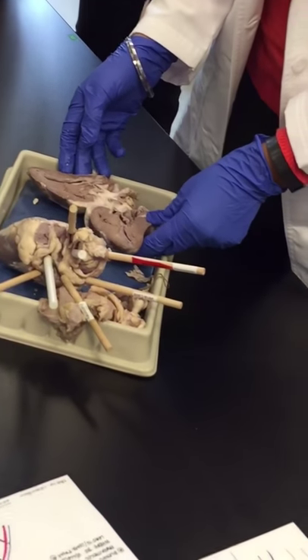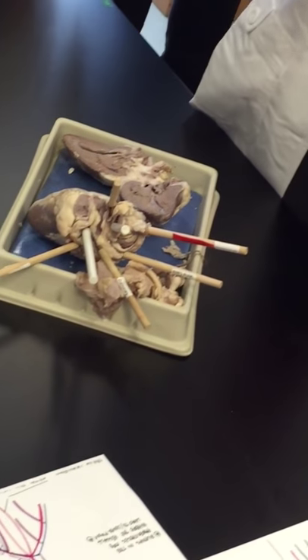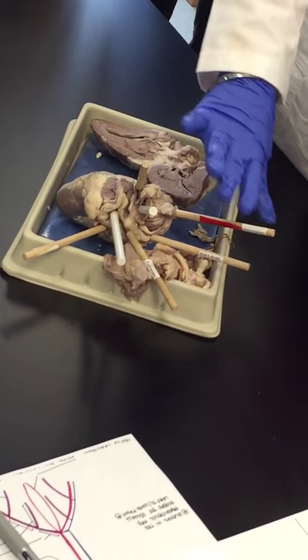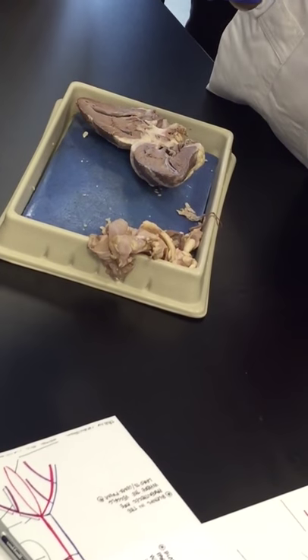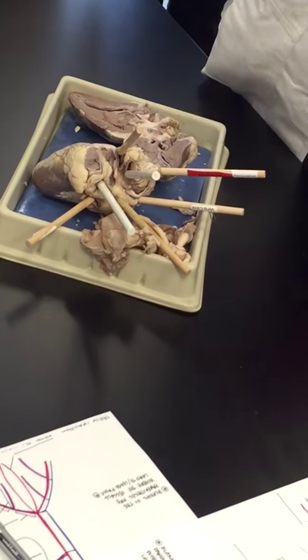That's all you need to know about the heart. I want you to come up with your lab manuals and identify each of these tubes and the blood vessel openings on your own.